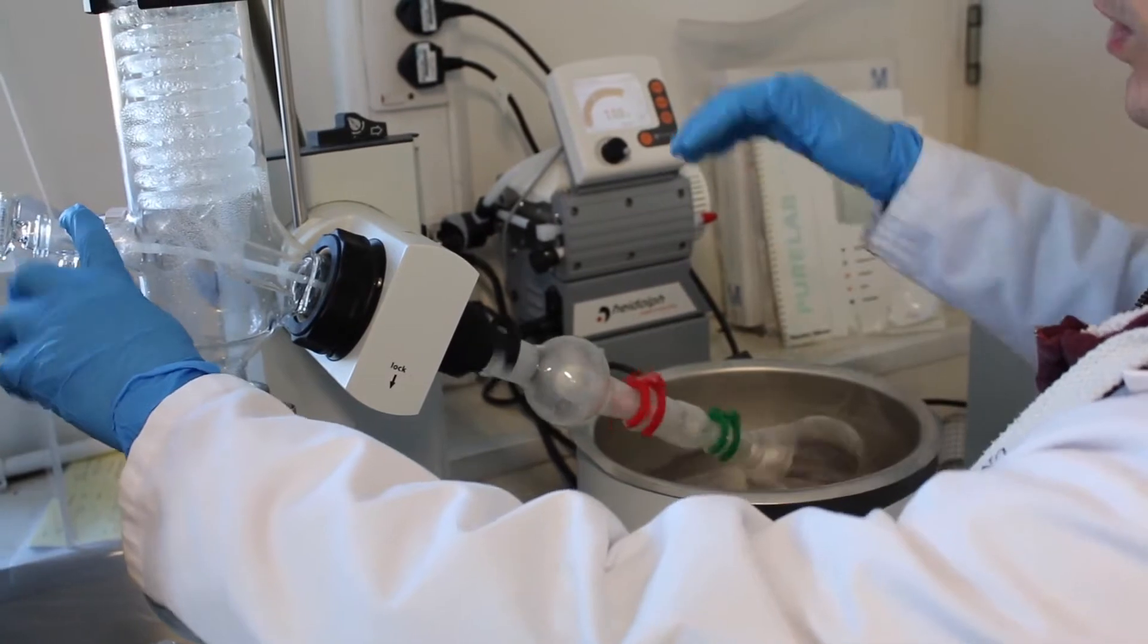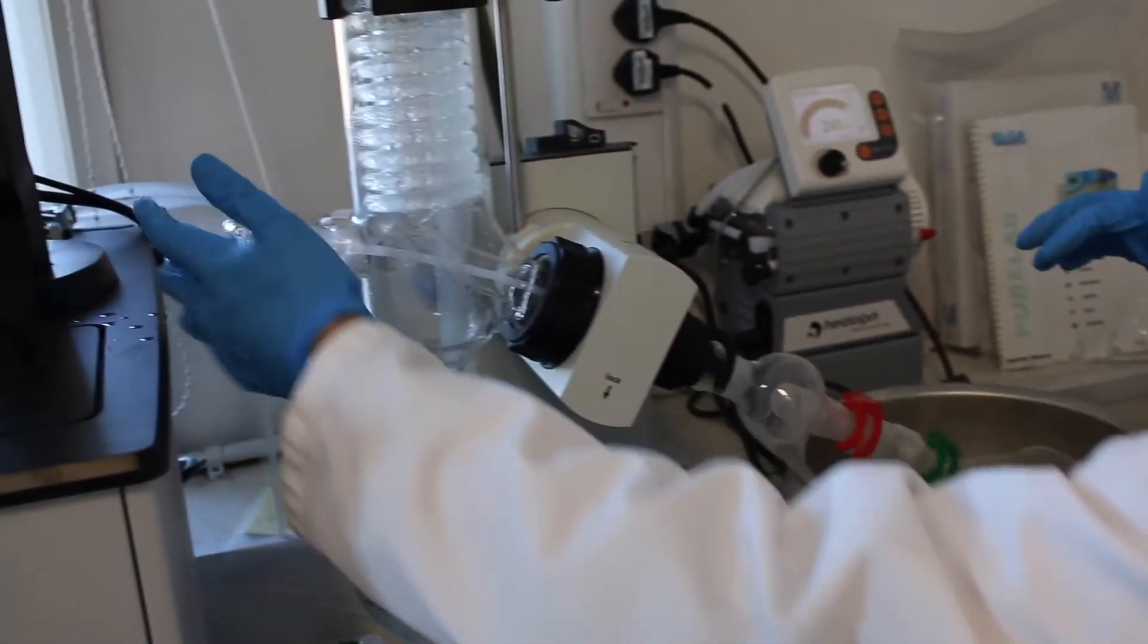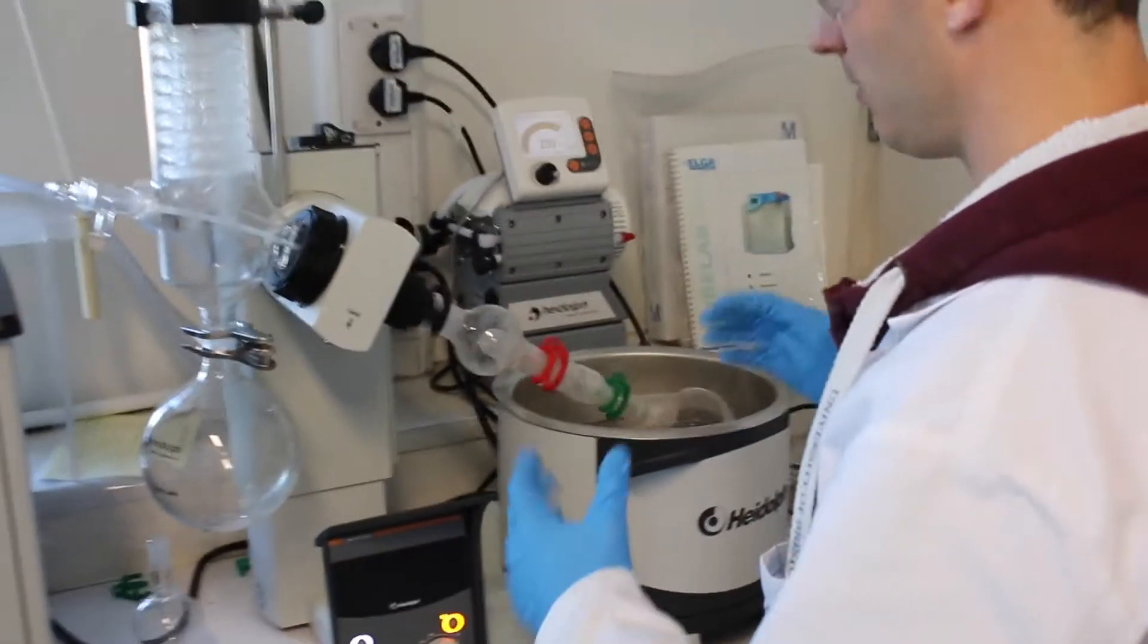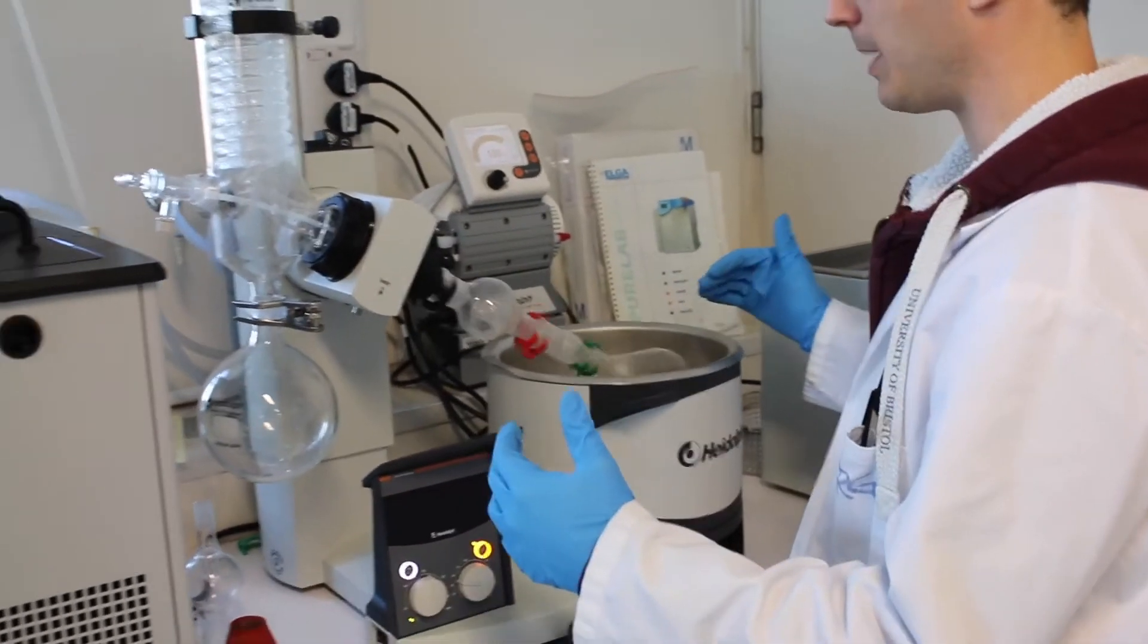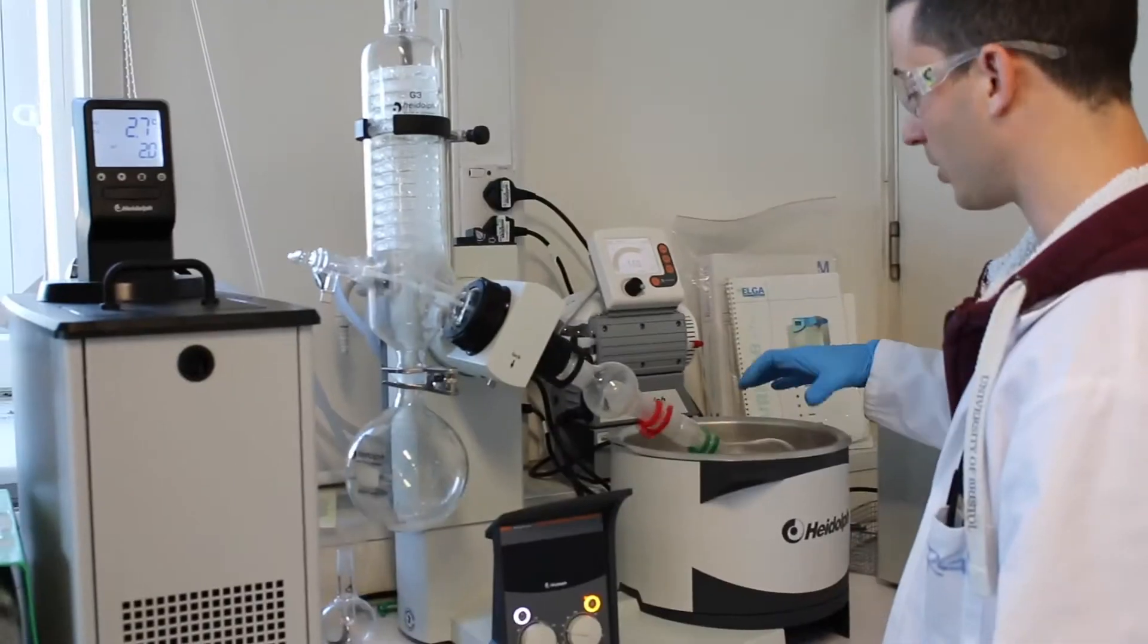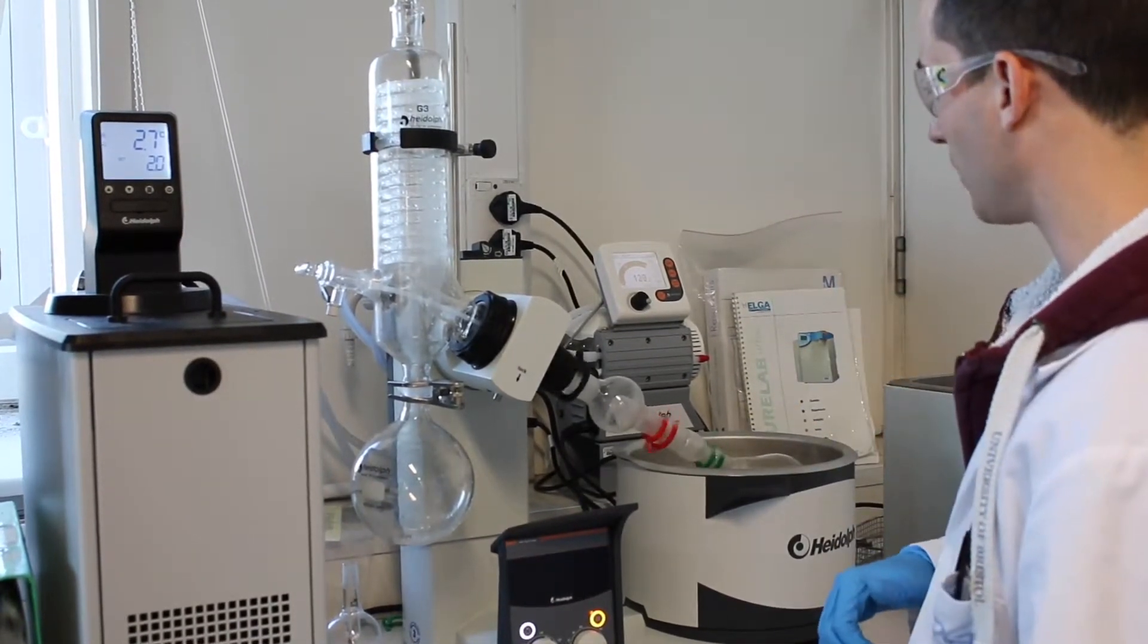At that point, you can safely close the main valve down here. Again, stay here for another couple of minutes to make sure that everything is fine and your solution is not boiling too vigorously.